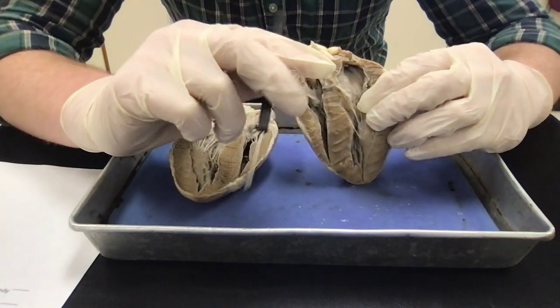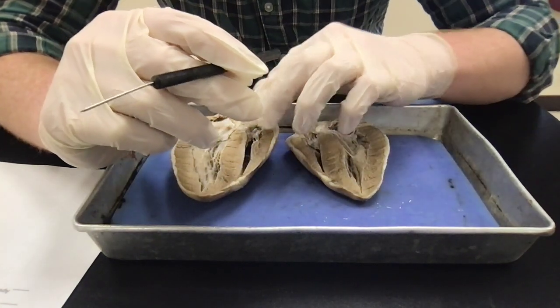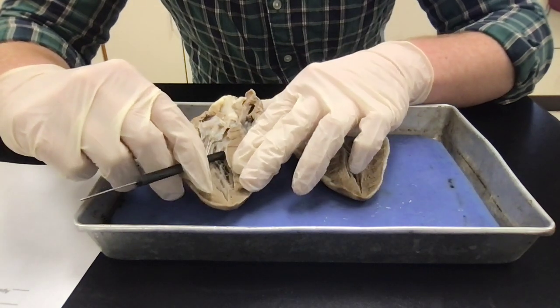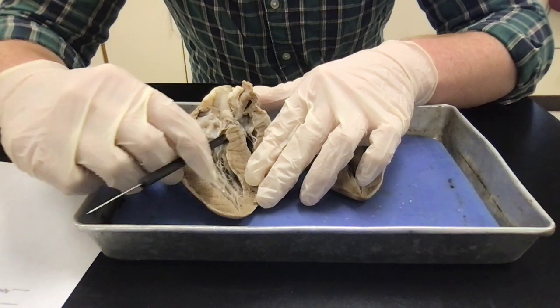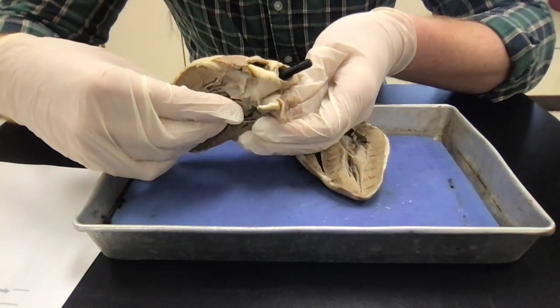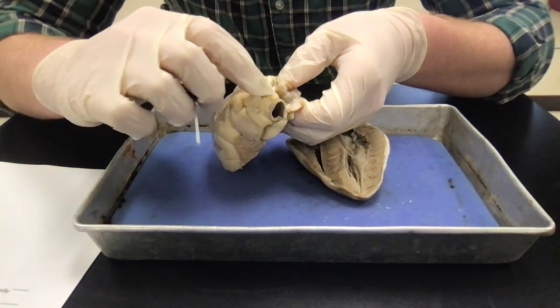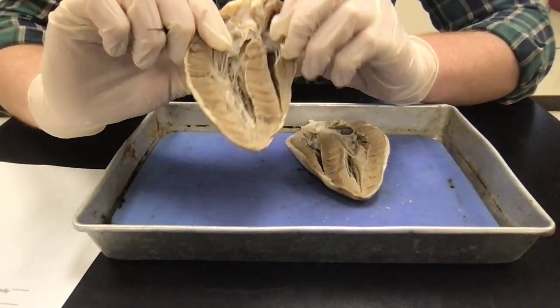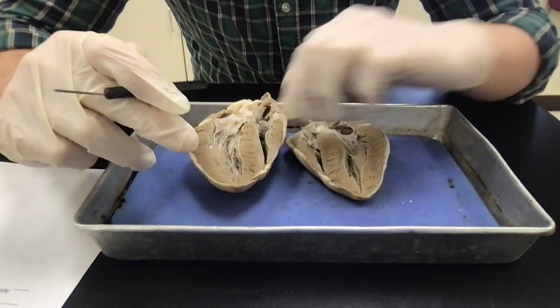Next, let's talk about the major blood vessels, okay? So, right here, that's the easiest one, is probably the aorta, and the aorta is continuous with the left ventricle. So if you put this little pen up here, it comes out this top side, all right, and then this as well as this other opening, this is the aorta, and that is going to branch off and feed the body with oxygenated blood.